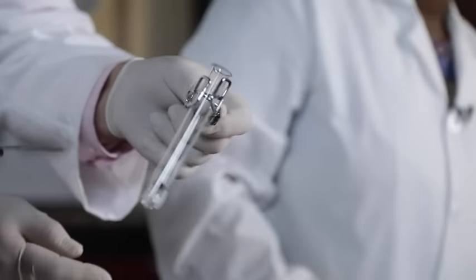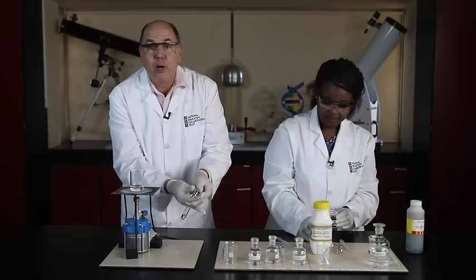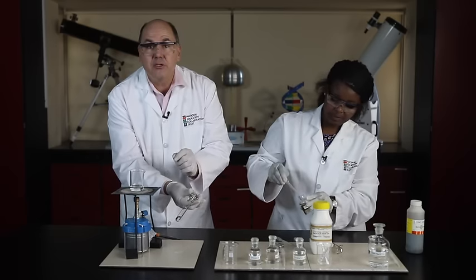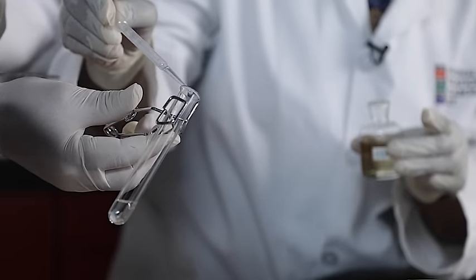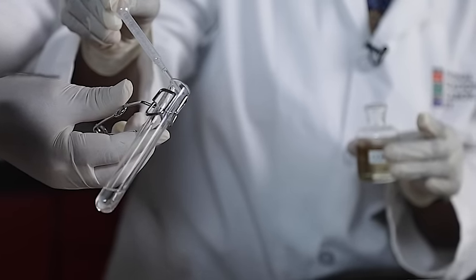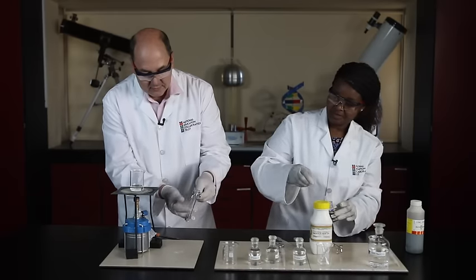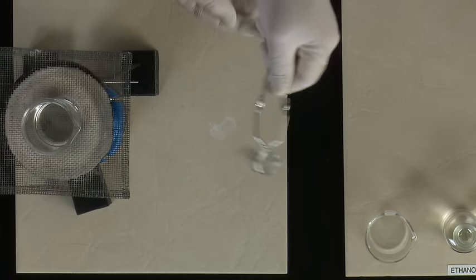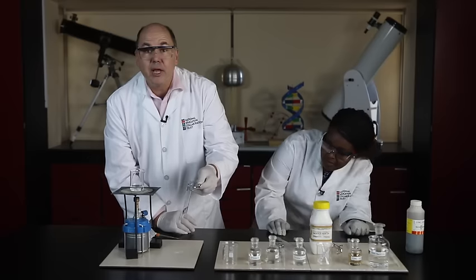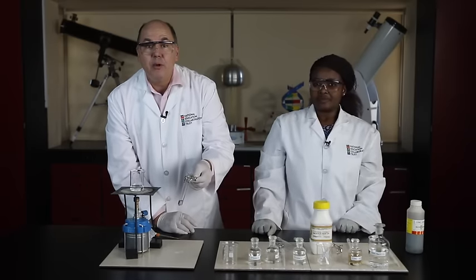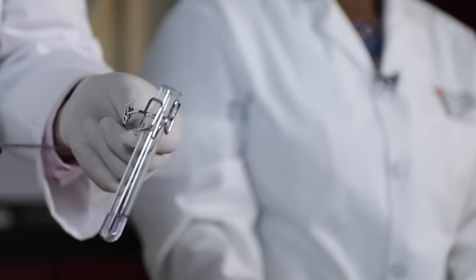Finally, we add the catalyst. We carefully add a few drops of concentrated sulfuric acid to the mixture, dripping it down the sides of the test tube. Here we go. It's one drop, two drops, and another one to make sure everything reacts. A couple of bubbles there. It looks like it might even be reacting. Sulfuric acid heats up when we add it to other liquids like alcohol or acid. The increase in temperature helps speed up the reaction rate.